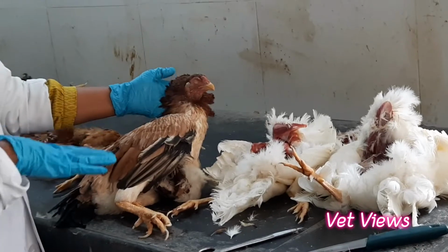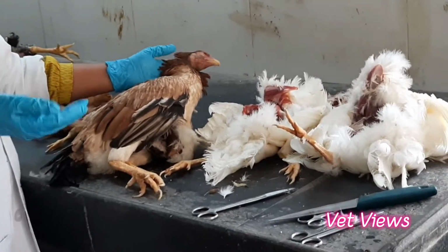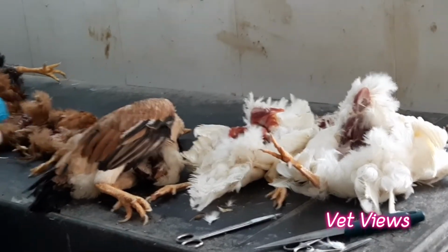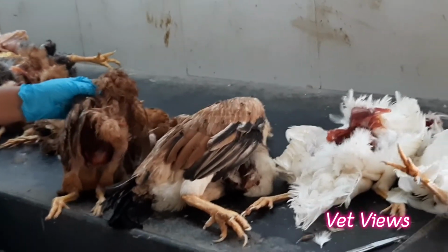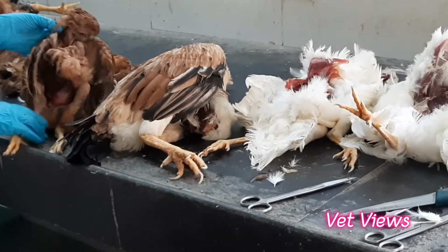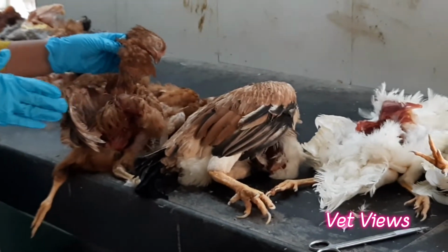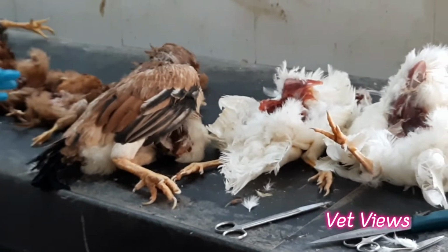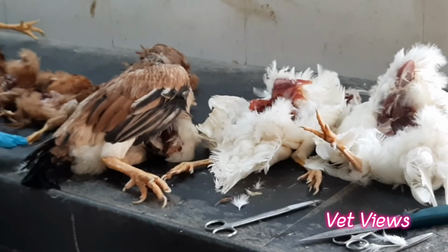When you start observing, just check the body condition, whether it is well built or having emaciation. Here, if you see, it is a well built bird. If you see this part, that means some rodent population in the shed. If some rodents are there, they start eating these debilitated birds. So this part is completely debilitated, and also the muscle setup is completely devastated. This kind of debilitation happens in some chronic diseases, like if any tumor development is there inside the body. This one you have to see first.